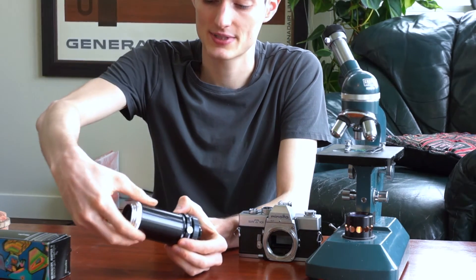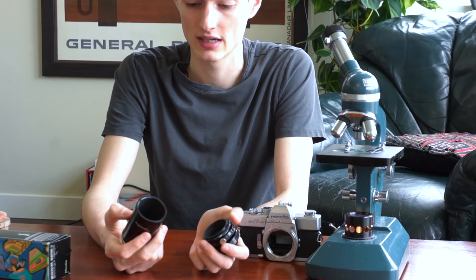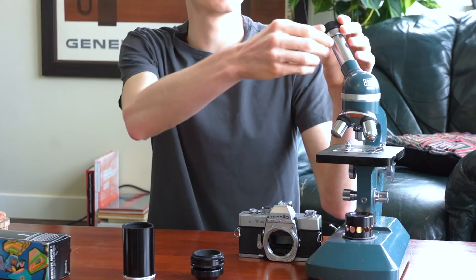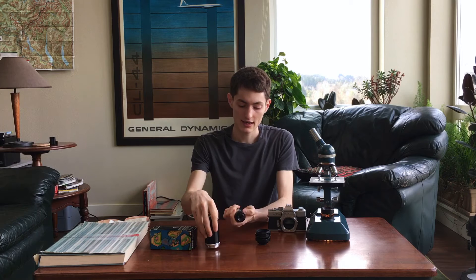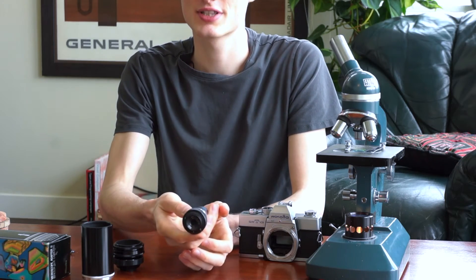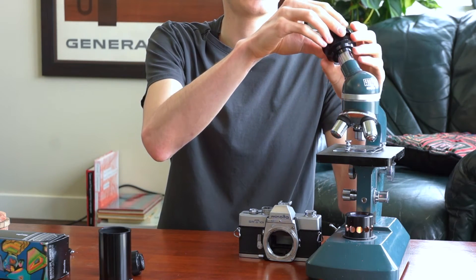Right above that, if I grab the top section and the bottom section, you can also loosen just the actual barrel here and keep that bottom section all together in one piece. Now with these two sections separated, in the case of this zoom eyepiece, that's actually how you have to mount the camera onto the microscope and get the eyepiece in place. So I'll first remove the eyepiece and remove the little screw that was locking it in place. A lot of eyepiece optics are going to be smaller than this, so this mounting order should work for almost every eyepiece. I'm going to take the microscope mount and put it onto the eyestalk, then loosen or tighten it up to make sure it's nice and snug.